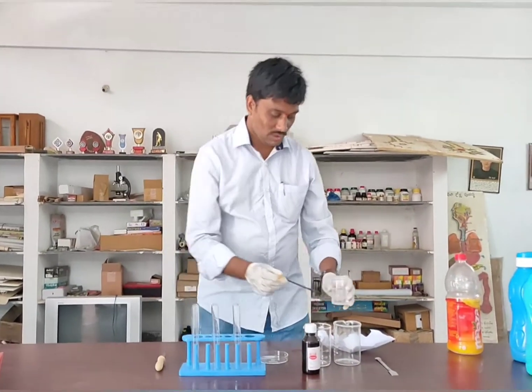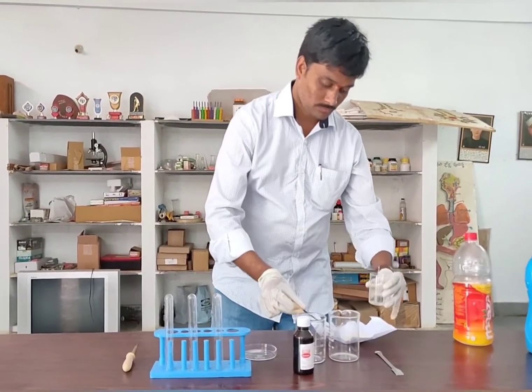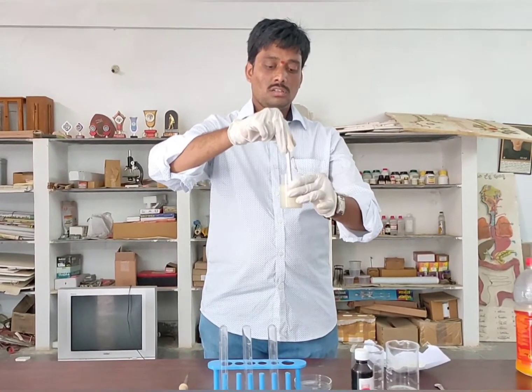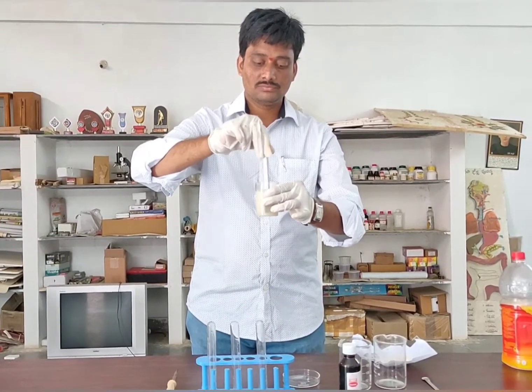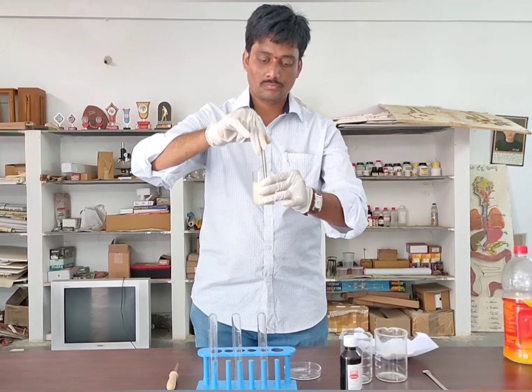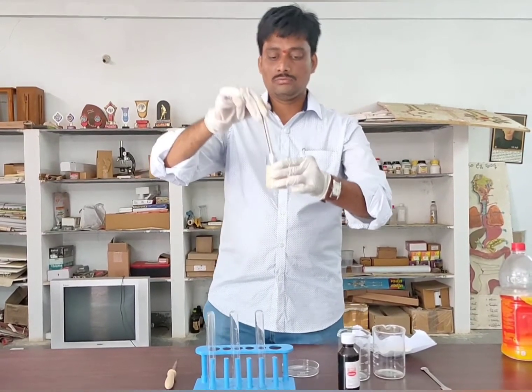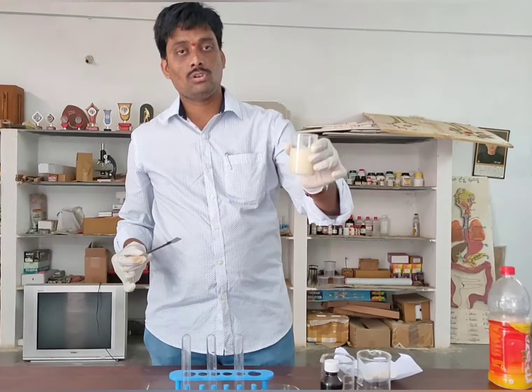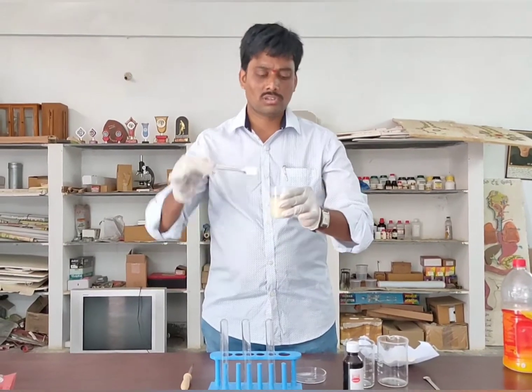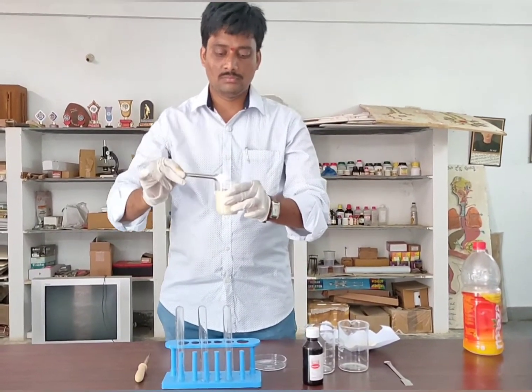First of all, we have to take flour into a beaker containing water. We have to add 2 pinches of flour in this water and stir it well. We have prepared a solution which contains flour. Actually, we have to take starch — if starch is not available, we can take any flour, like chapati flour or roti flour. Now I have prepared this solution.